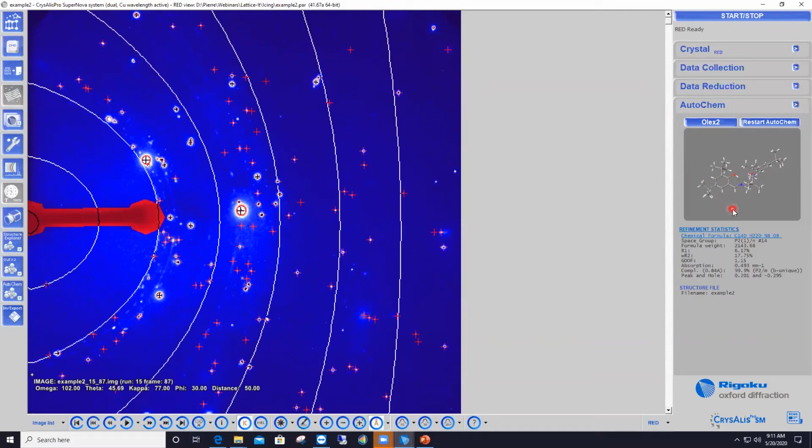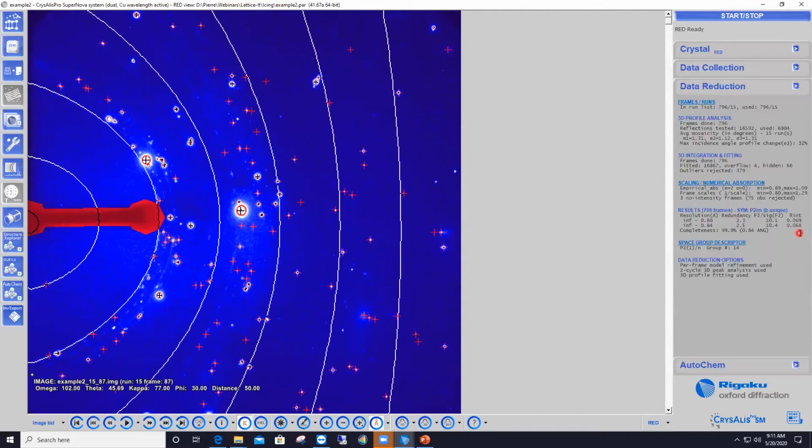So the reason for me choosing this data set is just for the sake of this webinar. I needed an example of an icy data set. Even though CrysAlisPro does a good job by itself, I'm still using this data set today for the sake of my demonstration. Okay. So you see that automatically, CrysAlisPro got a pretty nice structure here with about 6% R1. The R-int was about 7%. So for this dirty data set with ice features, this is not too bad.